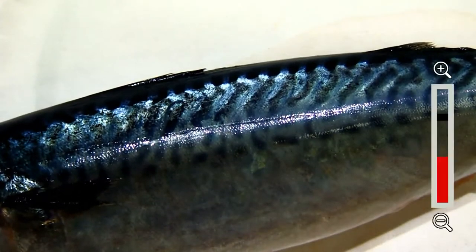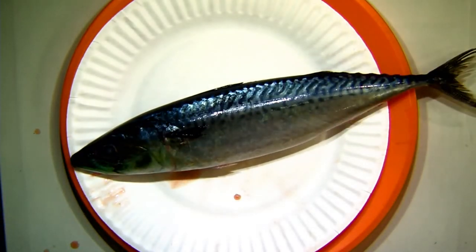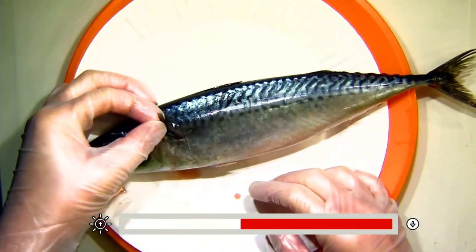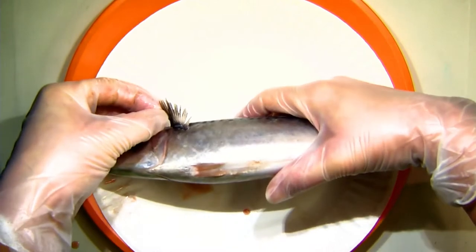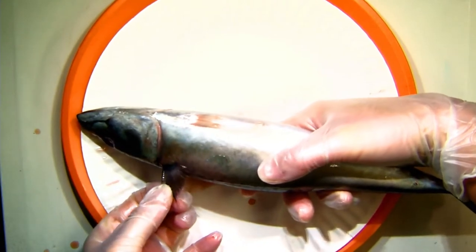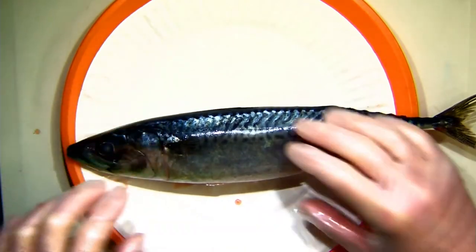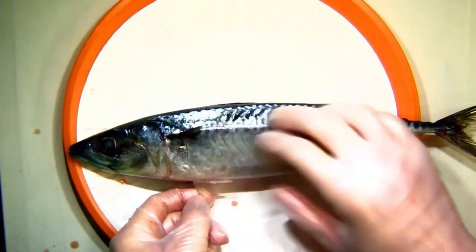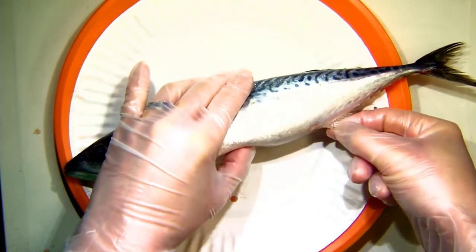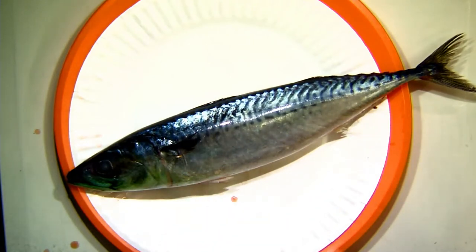The fish also needs to be able to steer — otherwise it will crash into things. It has fins on each side called pectoral fins, which are great for steering and maneuvering. It even has a few little fins on the bottom used for stability, and a fin near where it goes to the bathroom to help with that as well. All of these fins have a really important function for our fish friend.